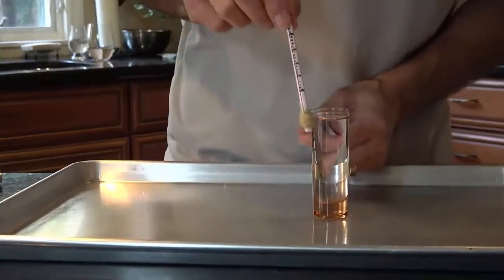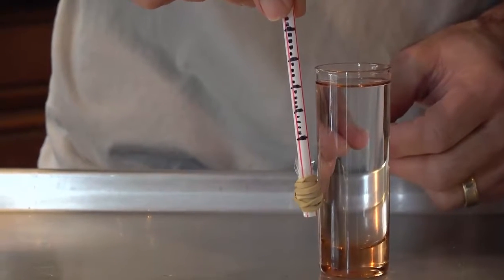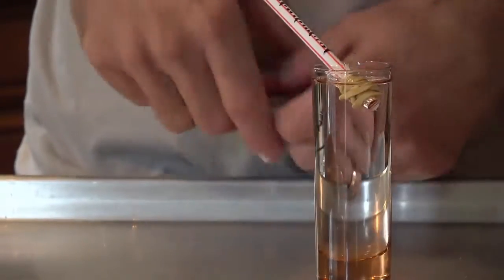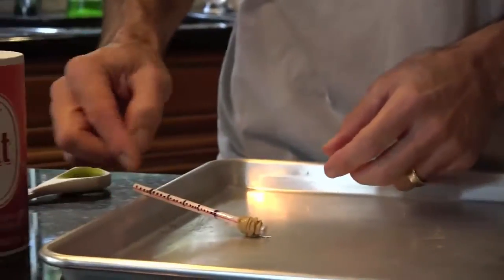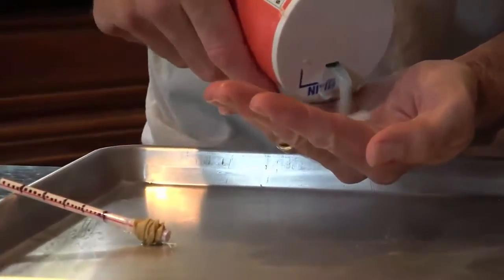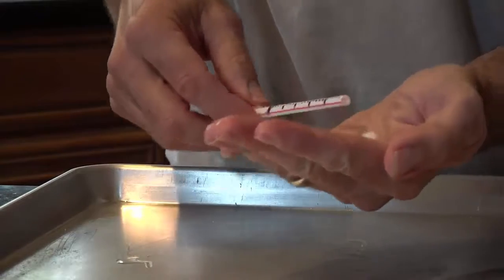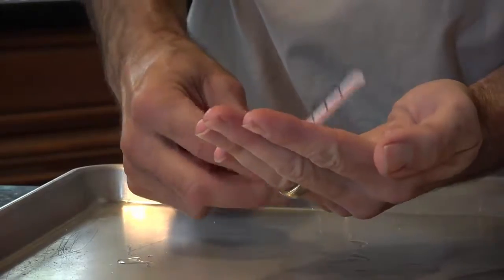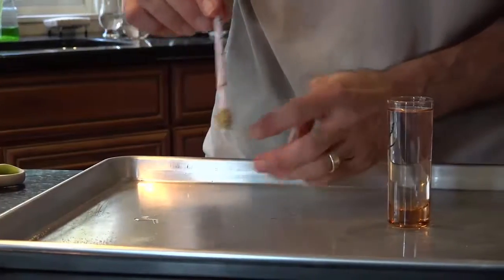Now we want this to float, but it has to be as far down as it can without touching the bottom. So if I just put this in here like this, it floats, but it doesn't go down very far. So I'm going to put a little bit of salt inside my straw. I'm going to put a little bit of salt in my hand, and then I'm going to put it inside my straw. And now I'm going to try again.